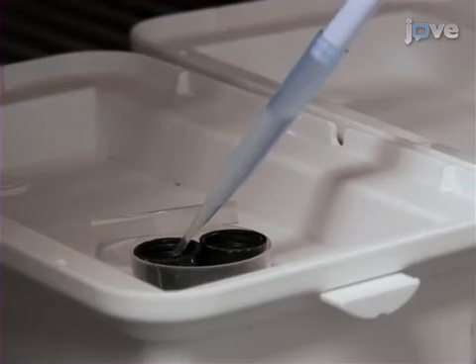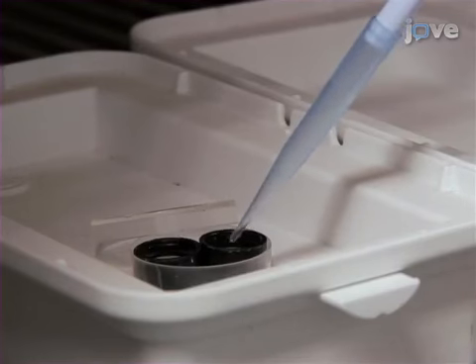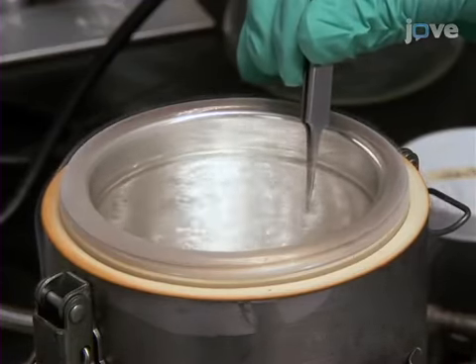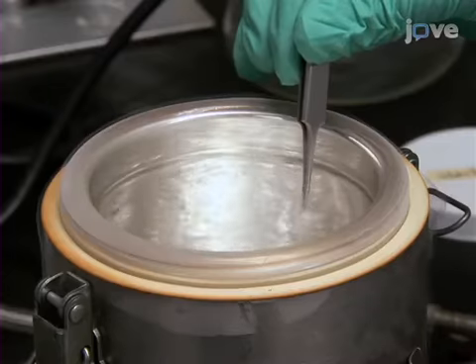Add 1 milliliter of -20°C 100% methanol to the well and leave the well at -20°C for the temperature to equilibrate. Now, freeze the yeast community by using tweezers to dip the membrane filter with the community in liquid nitrogen for at least 15 seconds.